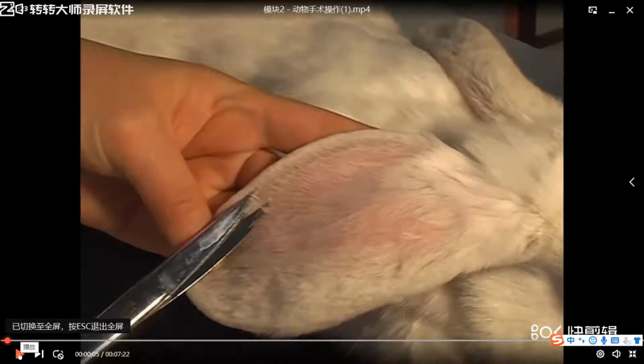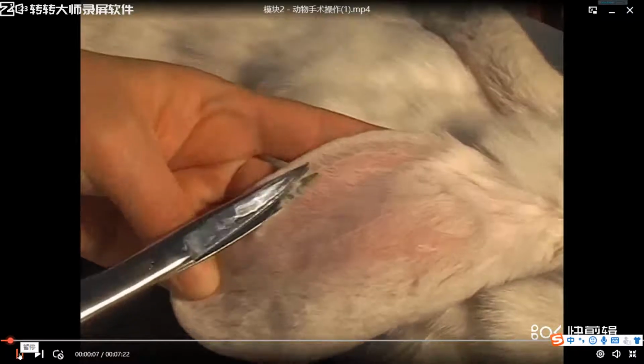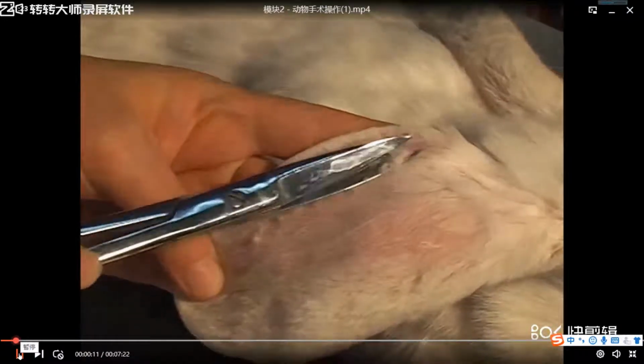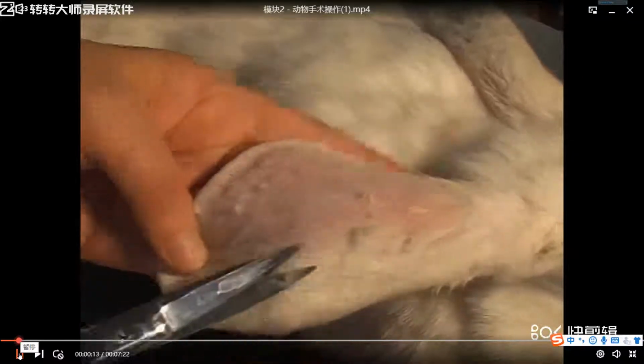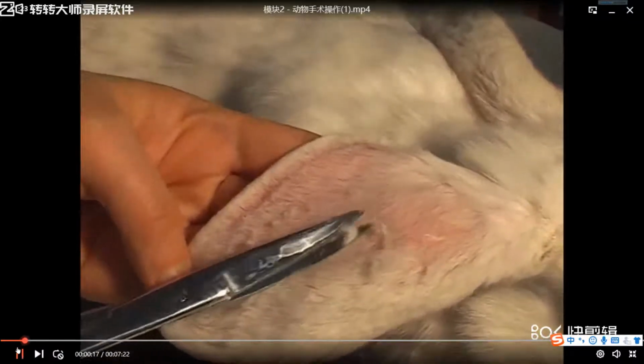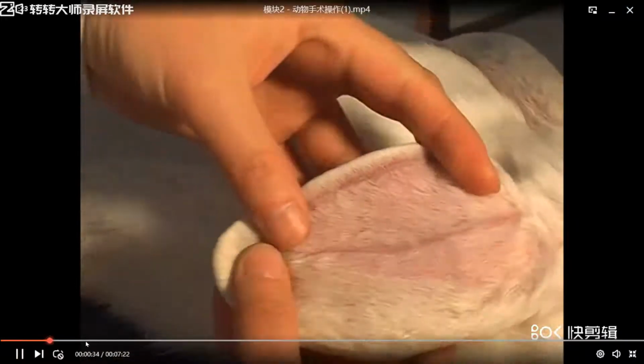In our class to do the experiment, let's look at it together. Cut off the rabbit fur along the vein. Yes, at first they cut the ear hair. Okay. Squeeze the vein with fingers to feel the pressure.